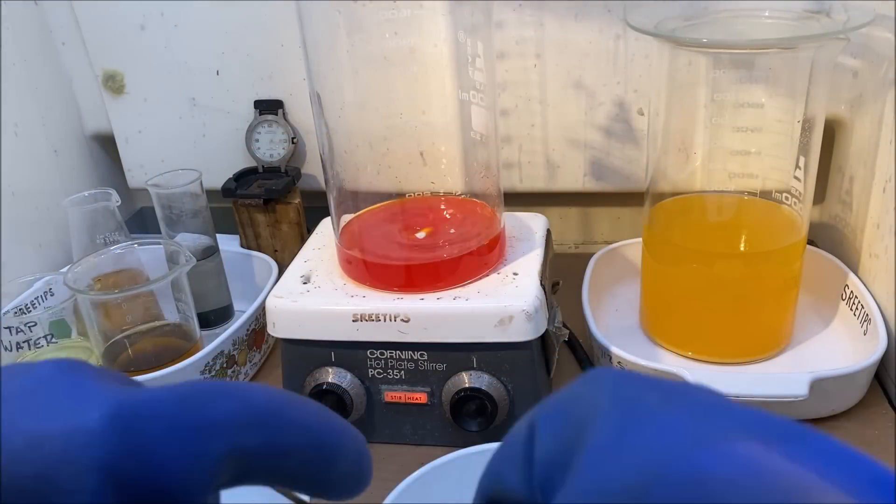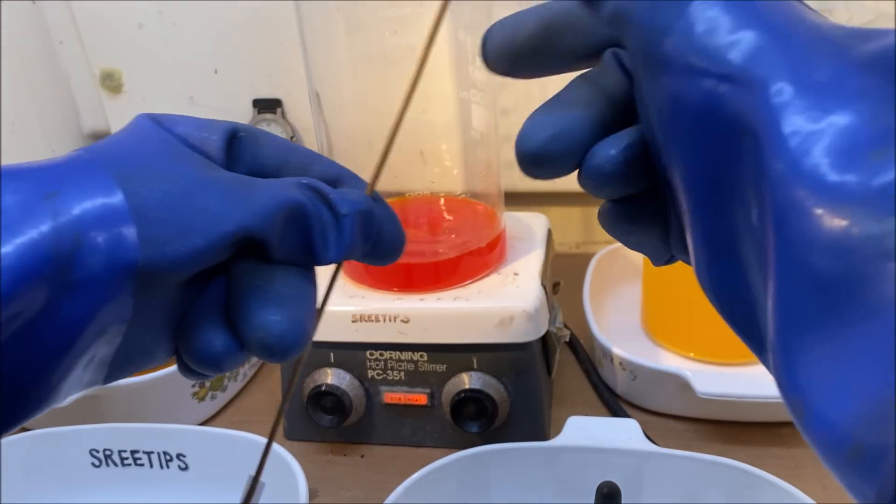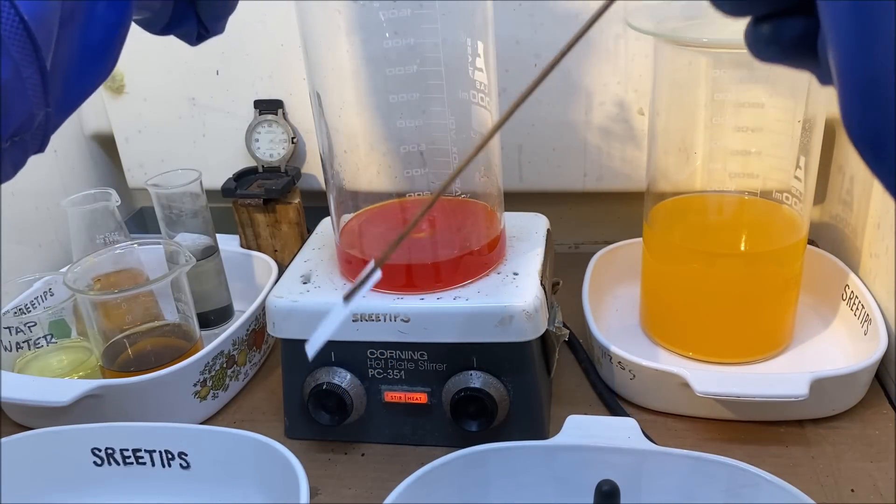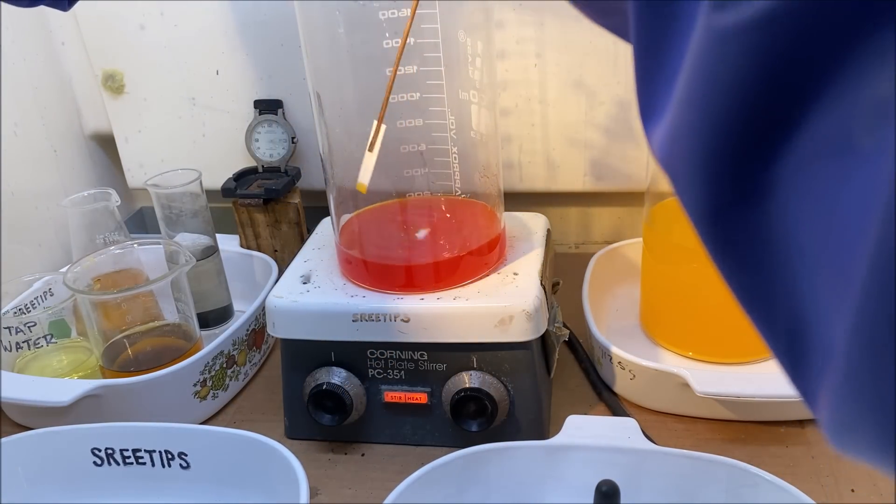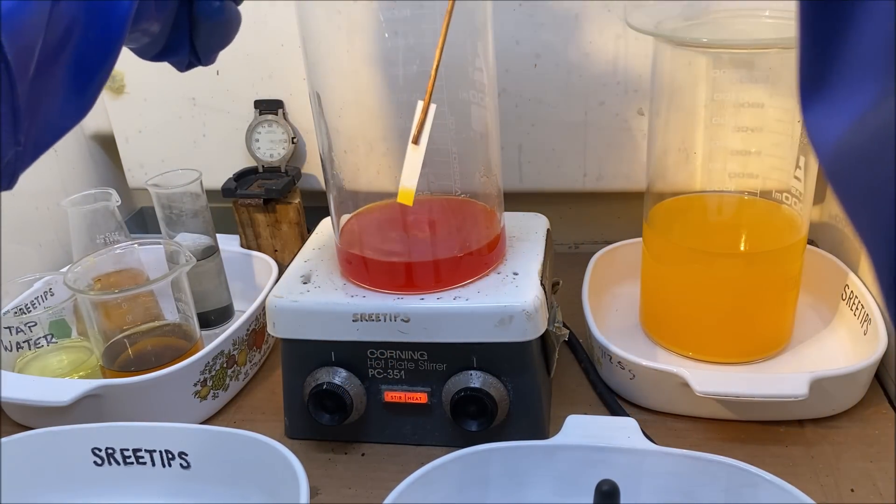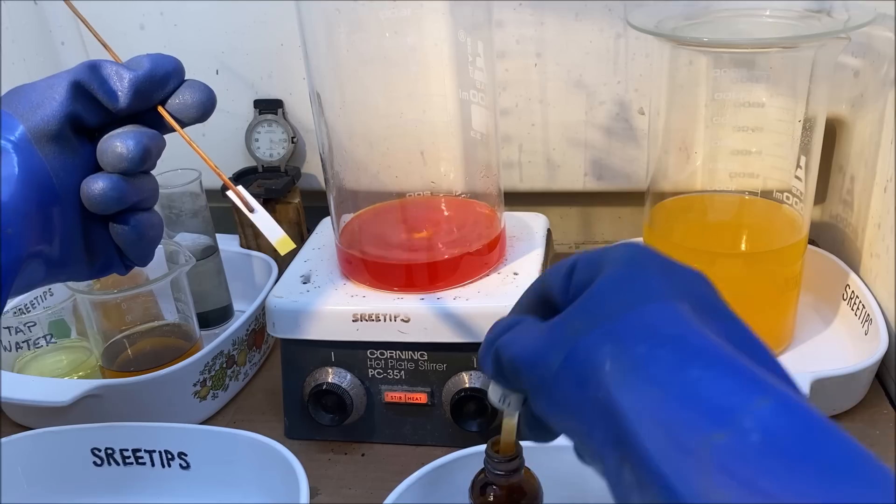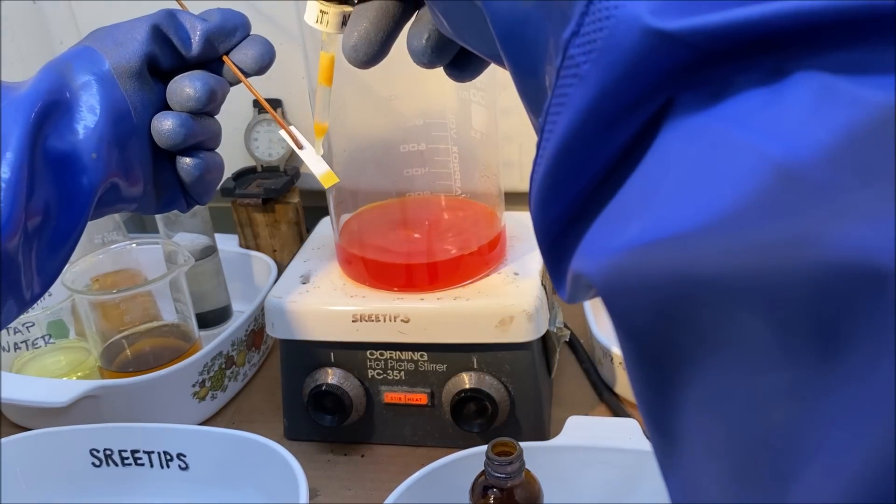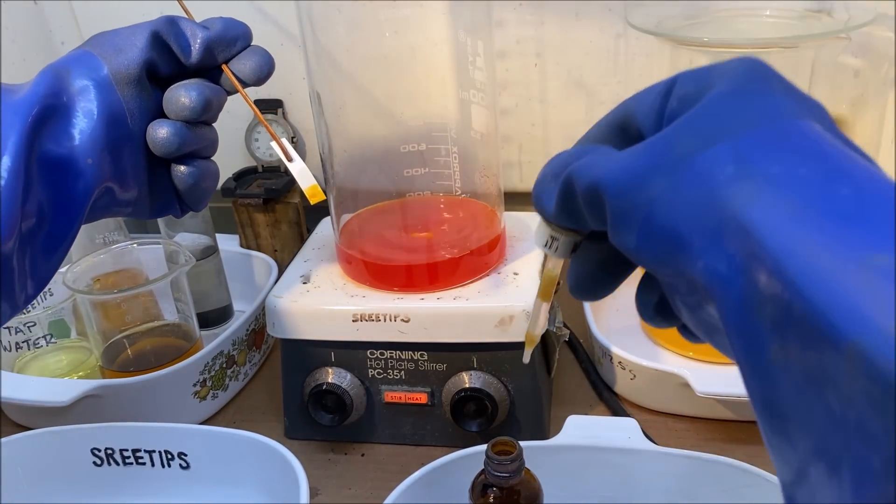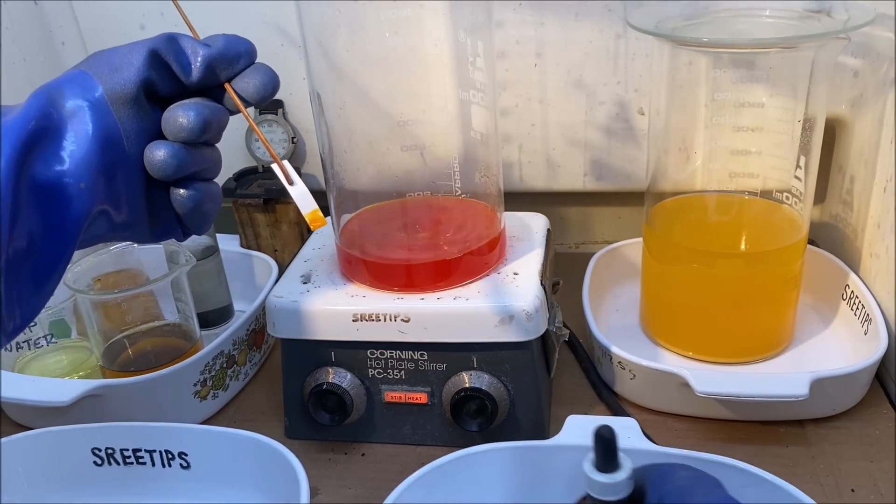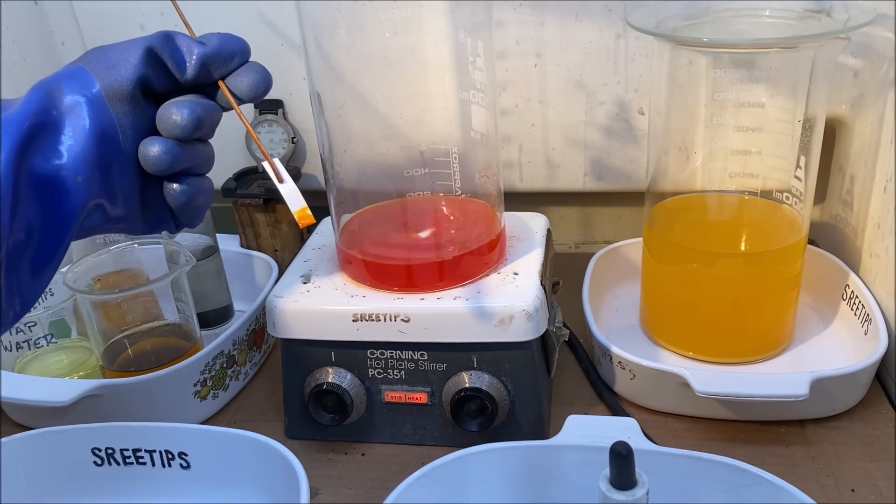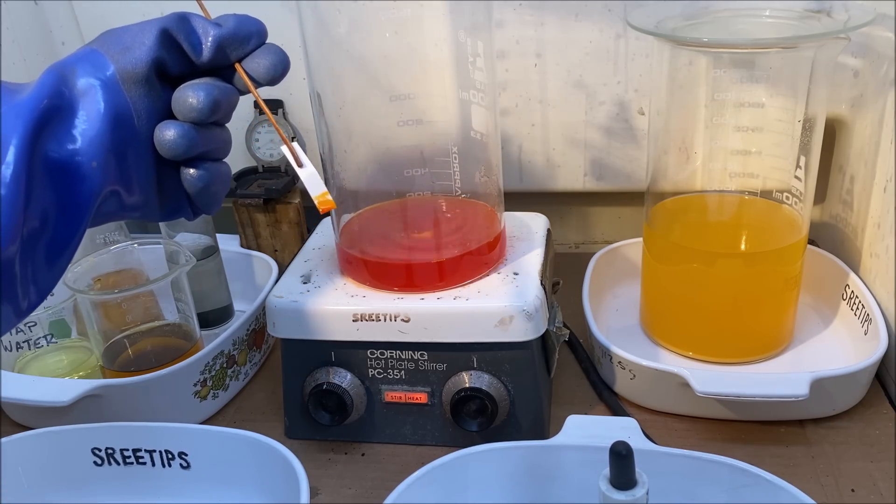I'm going to reach in here and get a little bit of this solution on a piece of filter paper. Let's test it and make sure we've got some platinum solution going on in this solution. Just like that. So that solution is loaded with platinum.